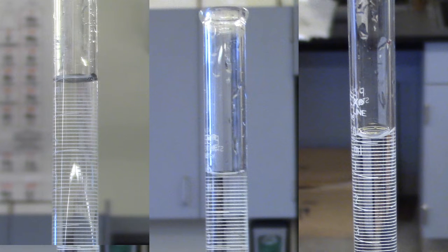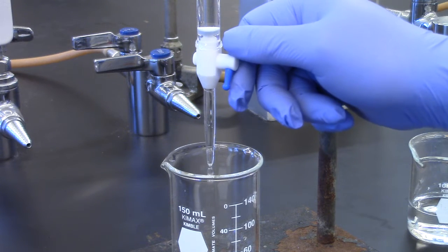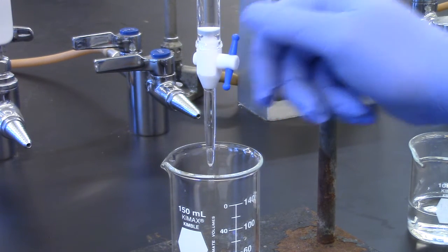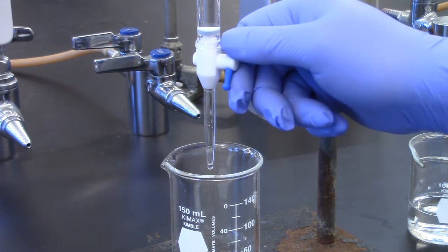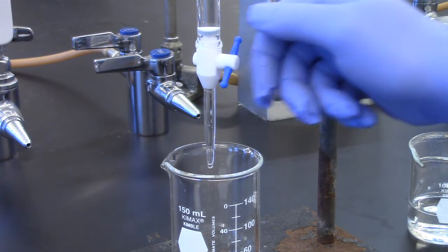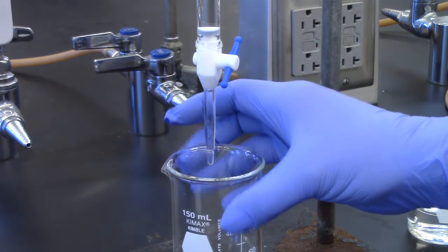Remember parallax while reading the burette. At close to the 10 milliliter mark, you can reduce the flow to a slow drip. With practice, you can even get a half or quarter drop by stopping the flow with the drop partially formed. Touch the drop to the side of the beaker to get it off the tip.